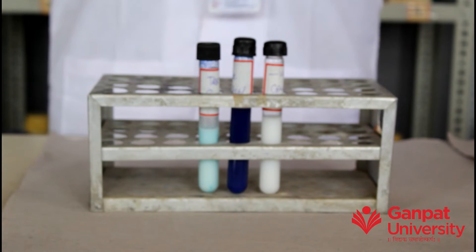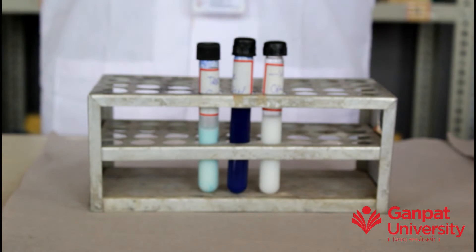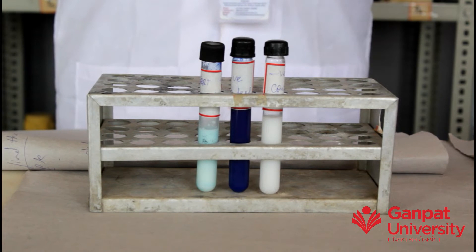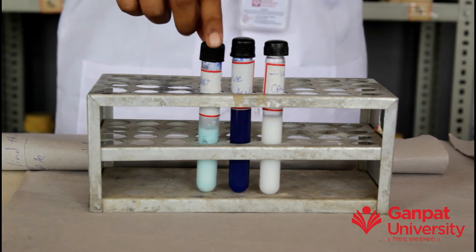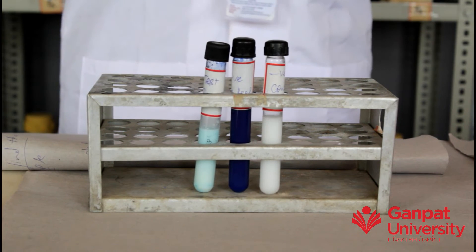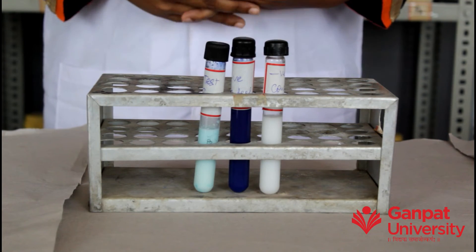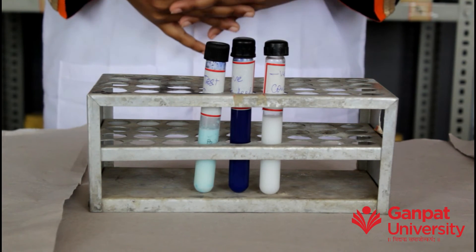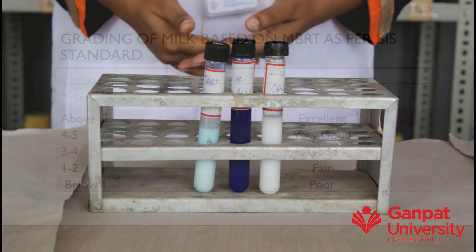Examine the tubes at every 30-minute intervals for color change. We observed color change in the test sample at 2 hours. On the basis of the standard table, our milk sample lies in the fair quality category.